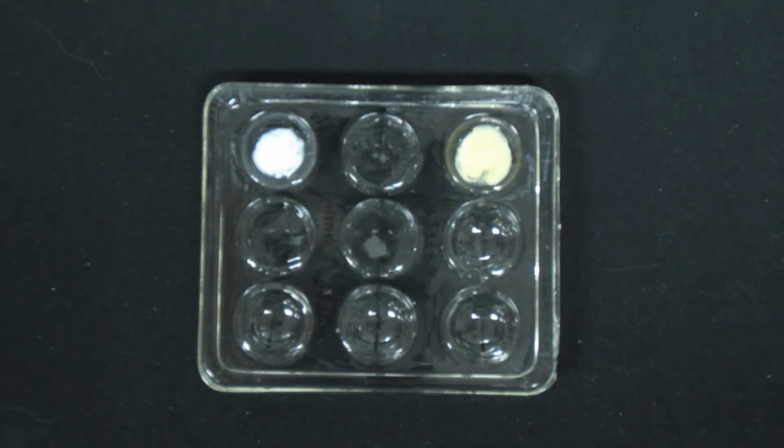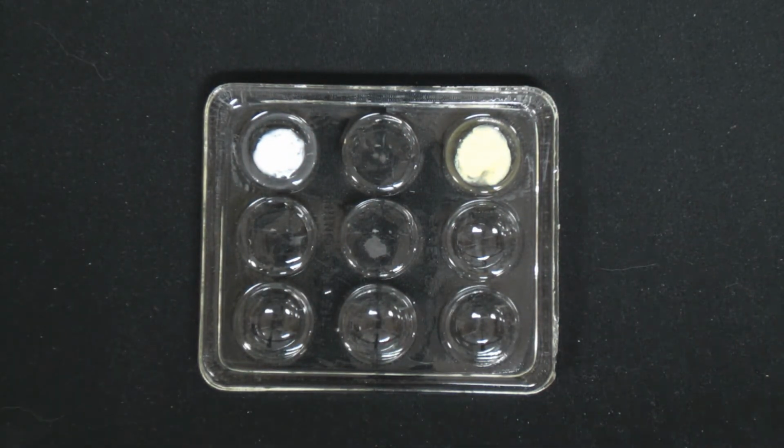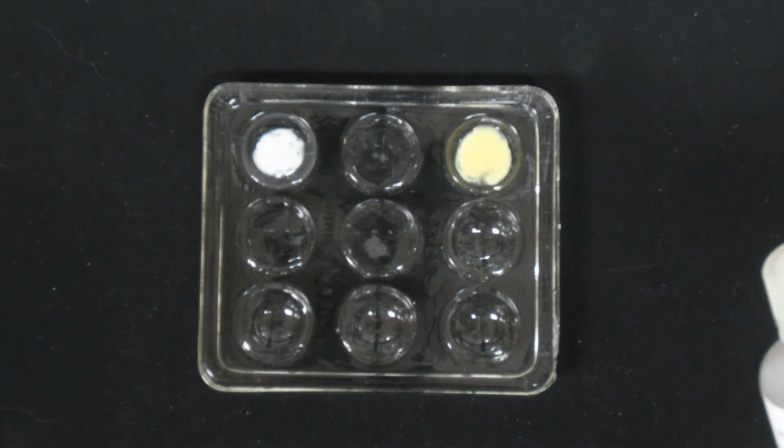Now for this particular one, I'll just tell you, calcium sulfate is considered an insoluble salt, but count this one as a solid forming as your observation. Some textbooks classify calcium sulfate as slightly soluble, so it's kind of on the borderline between soluble and insoluble. We're going to count that reaction as insoluble. That's the most consistent with typical textbooks.